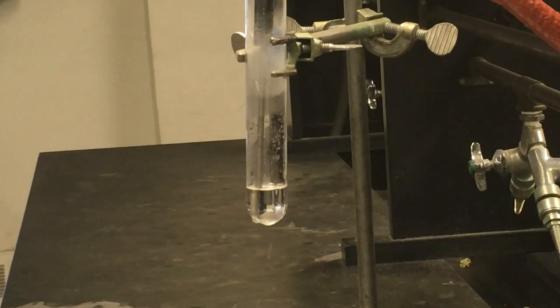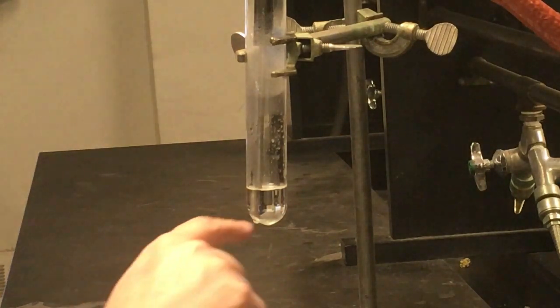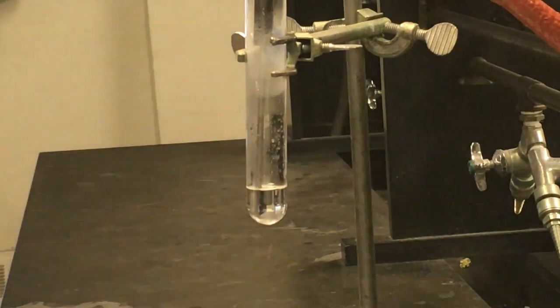Mainly just because naphthalene itself freezes at, we saw 79.1 from our first trial. Now that we've added stuff to the naphthalene, our freezing point should be lower. So it's going to take a little bit longer to freeze, although it is cooling down still very quickly now that we've removed it from that hot water bath. In fact, we're already below where naphthalene would have frozen previously. And if we take a look here at our solution, keep an eye on it. We don't really have a whole lot going on in our solution just yet.